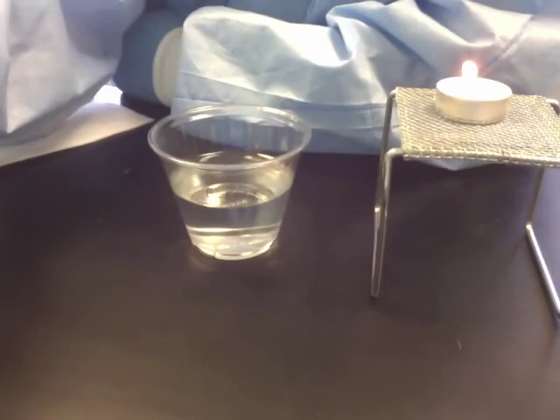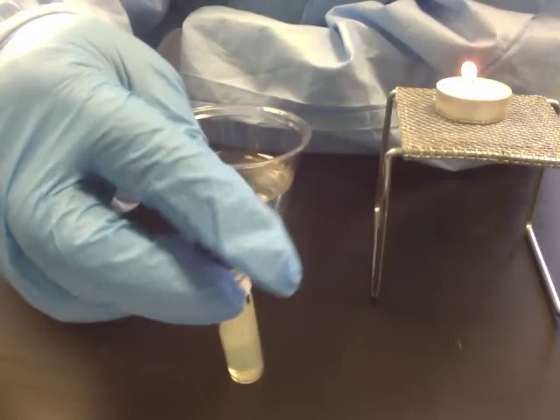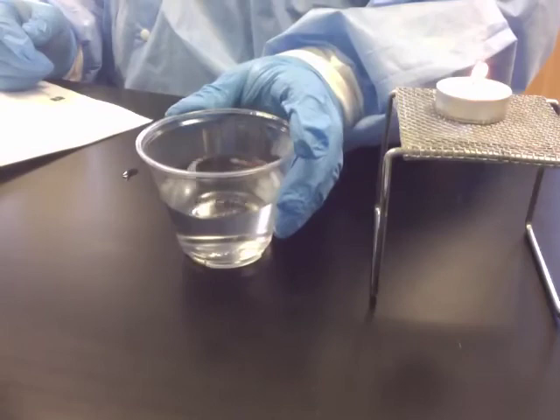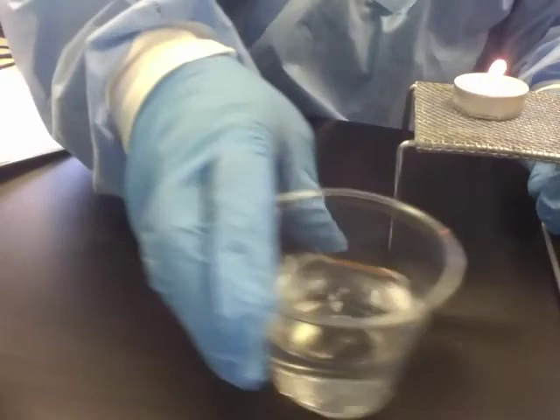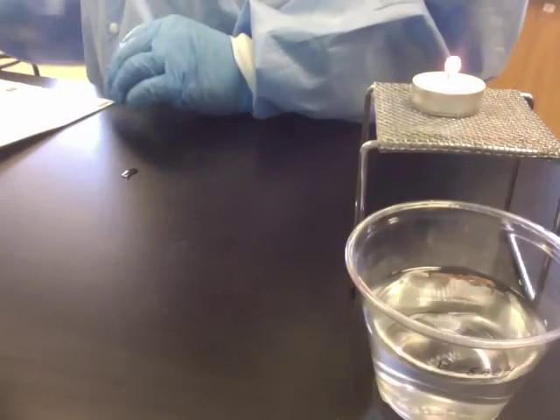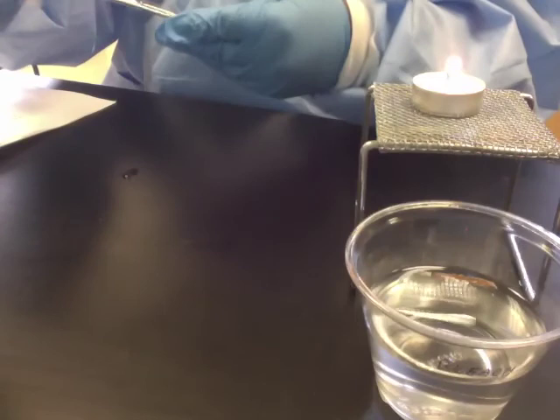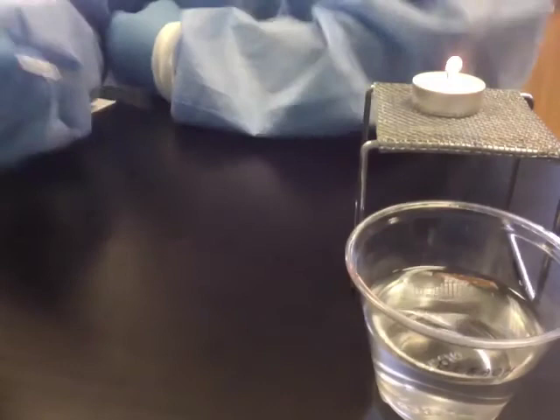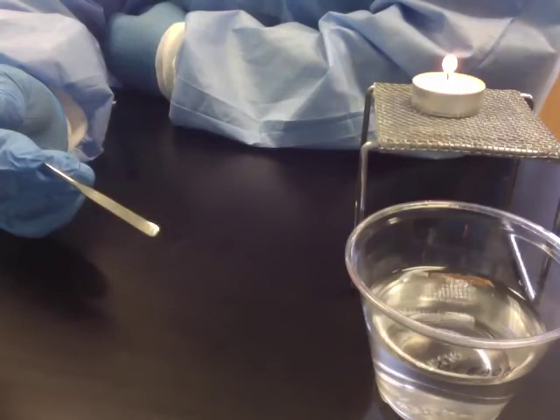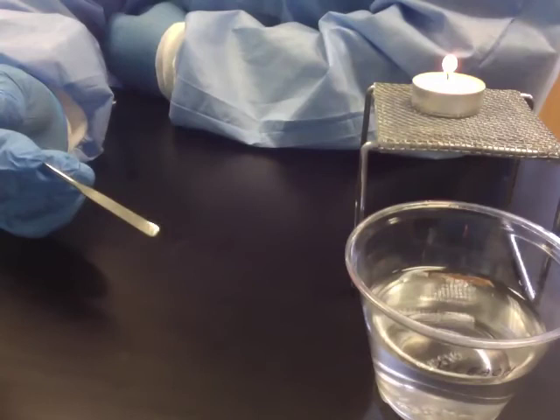And this is the ice machine handle — you can see microbial growth here as well. First thing we want to do is prepare: here's my bleach, there's my candle. I'm going to move these so they're easier to maneuver. There's my spatula — I'm going to move it from its plastic wrapping. I'm going to use the round end of the spatula because I think it's easier to pick off a single colony with the round end. We also want to write on our slides ahead of time where we're getting our sample from. So on slide A I'm writing '108 door handle, small opaque colony (SOC)' and putting today's date. You can see the description on the right side of the slide and the letter designation in the upper right-hand corner.